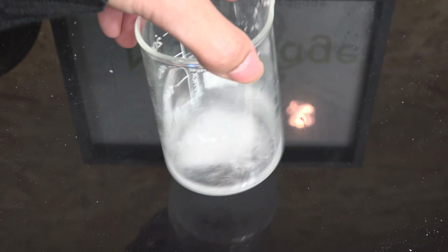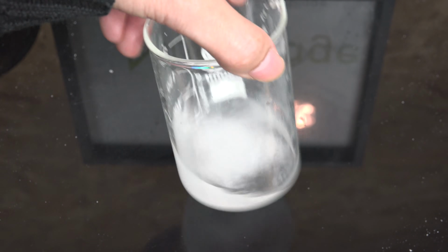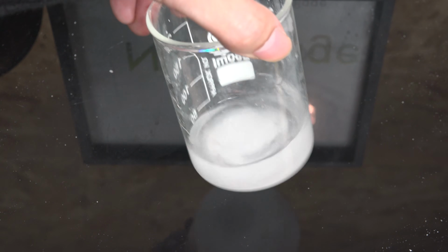So try and use an already low solubility solvent if you can, and lower it further with saturation rather than rely on saturation alone. I'll be honest though, for most amateur work, I've used water for even highly soluble chemicals as long as I saturate it. We amateurs just don't need that much accuracy.